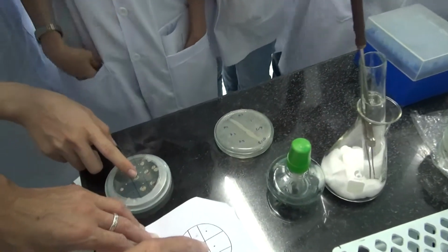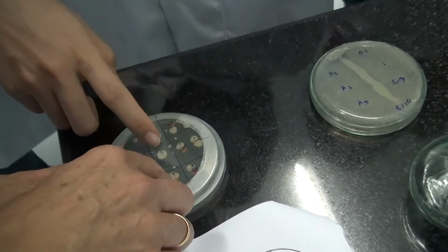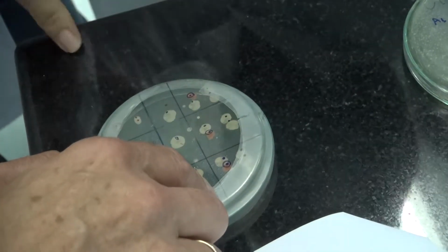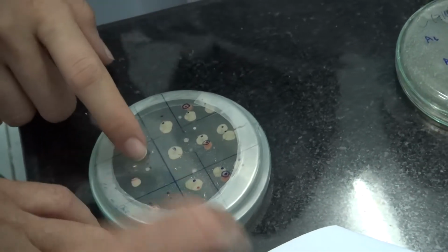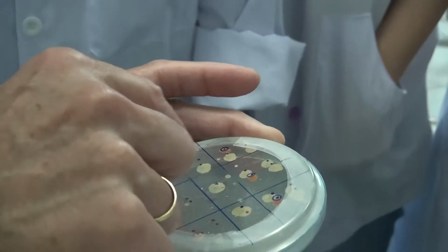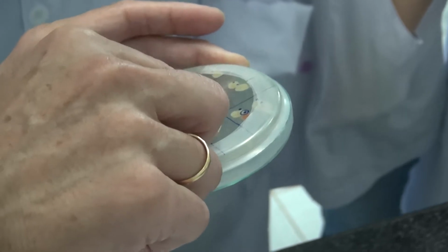This one is copiotrophs. The blue point is copiotrophs, and the blue points with a circle around are copiotroph E, copiotroph A, and copiotroph B, and the red point is actinomycetes. Okay. So you see, for instance, here, the copiotrophs, they seem not to have many interactions together, right? Because they all grew nicely. Now, what is that? This is the copiotroph and actinomycete, copiotroph and actinomycete, copiotroph and actinomycete.